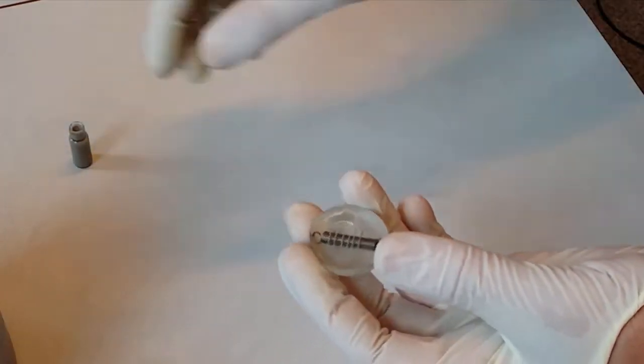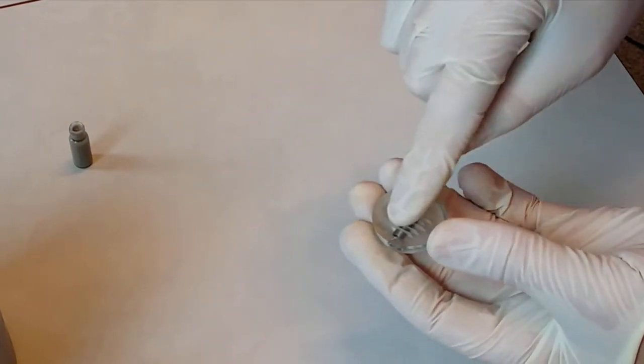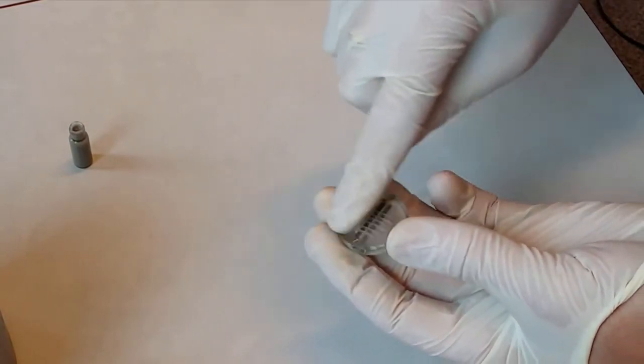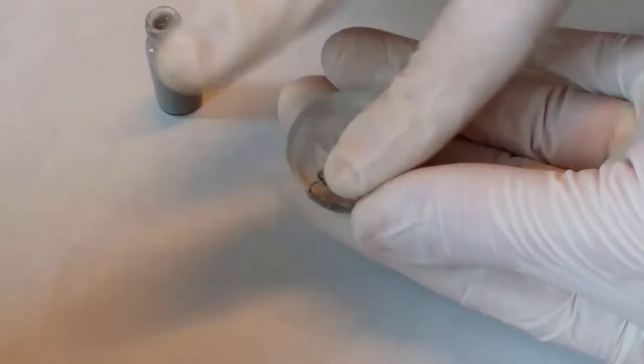At the last stage when I polish with the one micrometer diamond paste, I usually just use my rubber gloves and rub them back and forth across the sample.